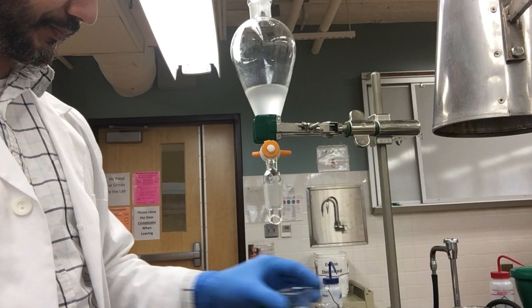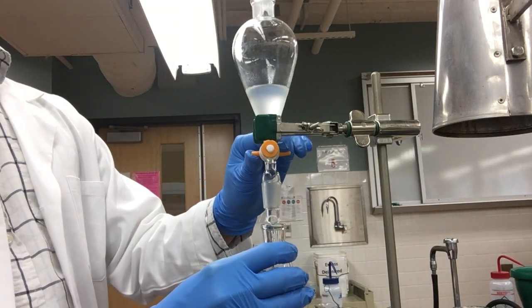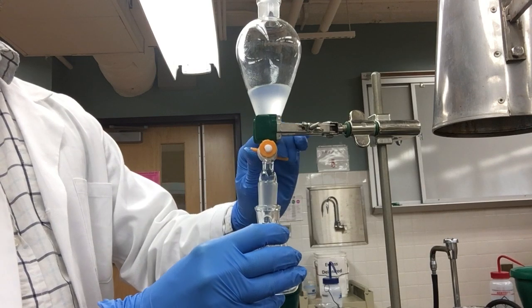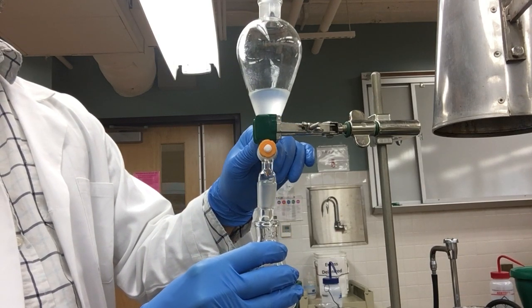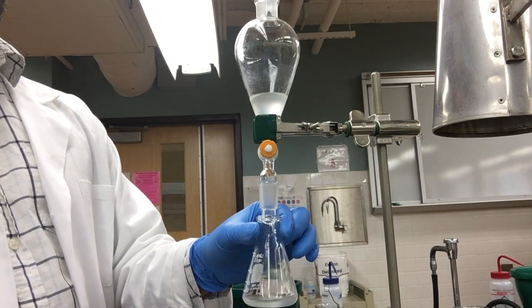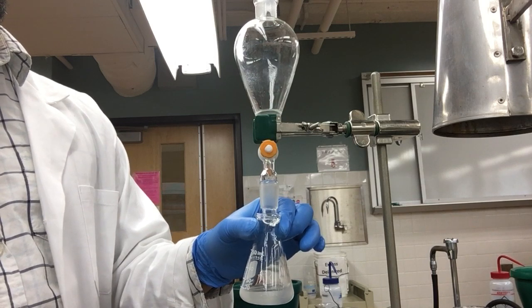With that removed, we will now also remove our organic layer. However, we will collect this layer in a small 50 ml Erlenmeyer flask.